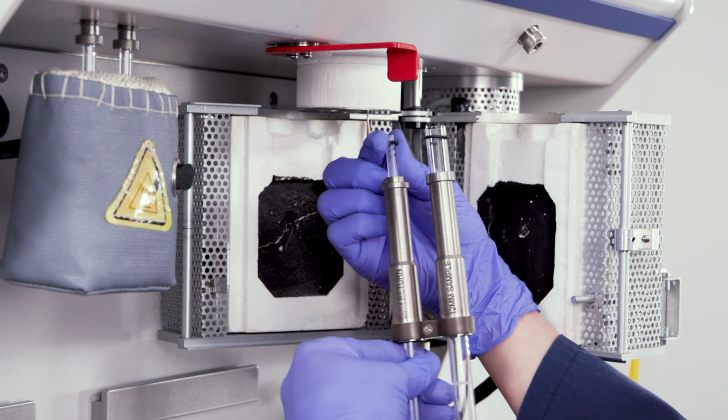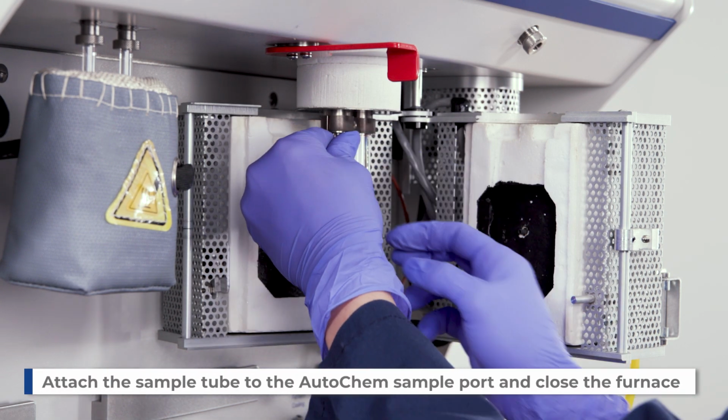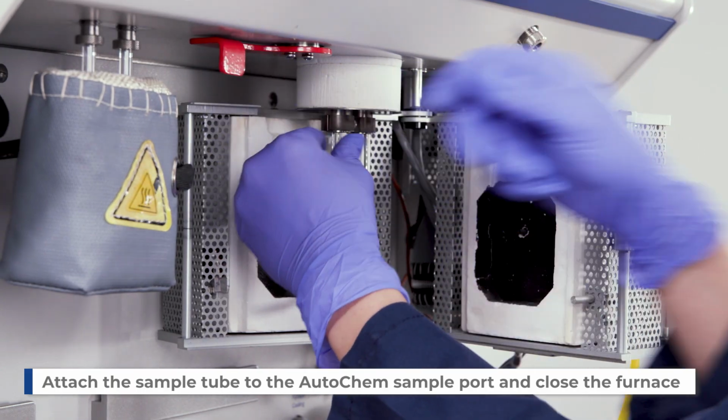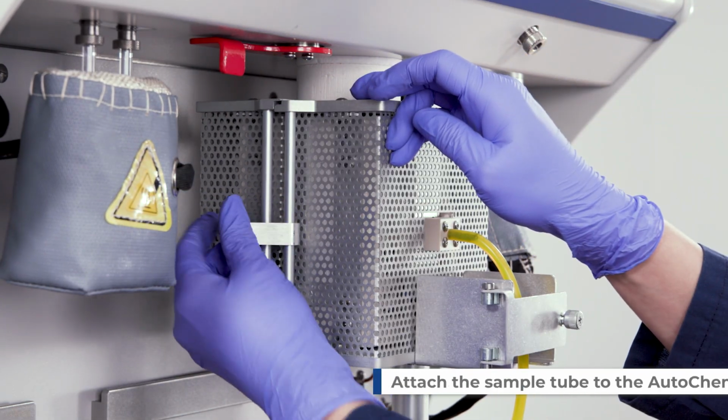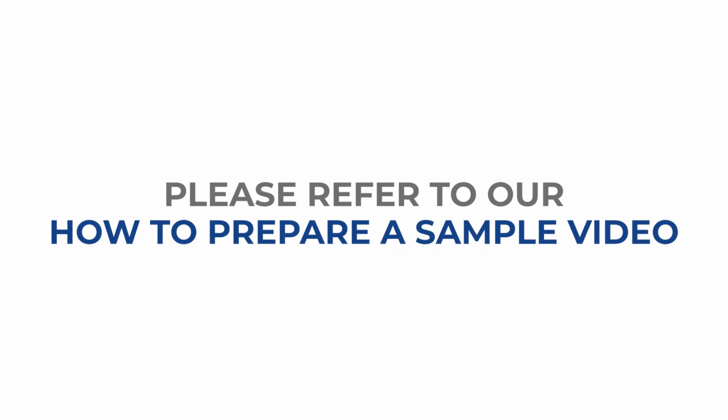Insert the sample collar and O-rings to the sample tube. Attach the sample tube to the AutoChem sample port. Turn the quick connect to lock the sample tube and close the furnace. For a more detailed demonstration, please refer to how to prepare a sample for the AutoChem III video.